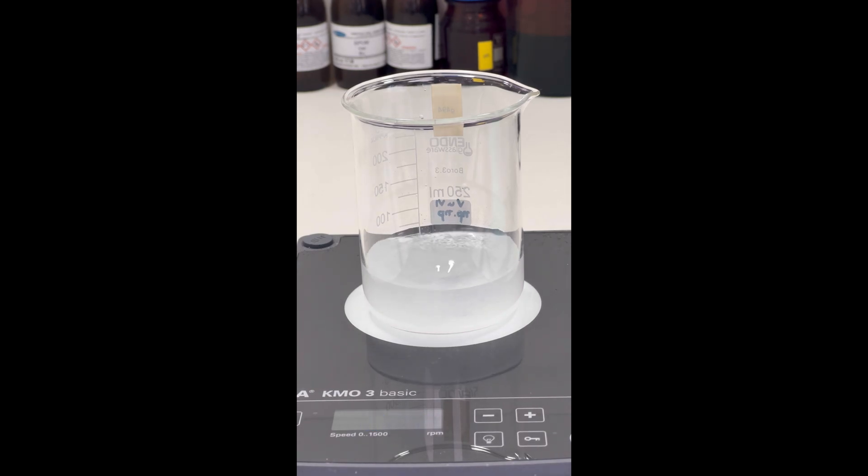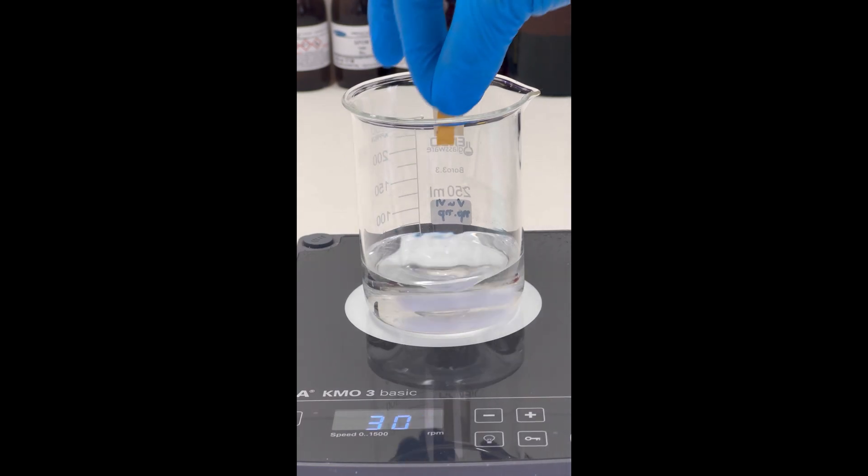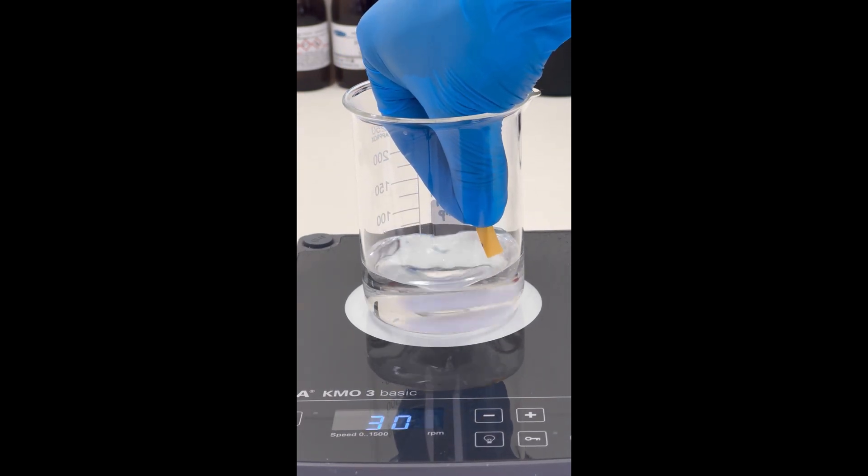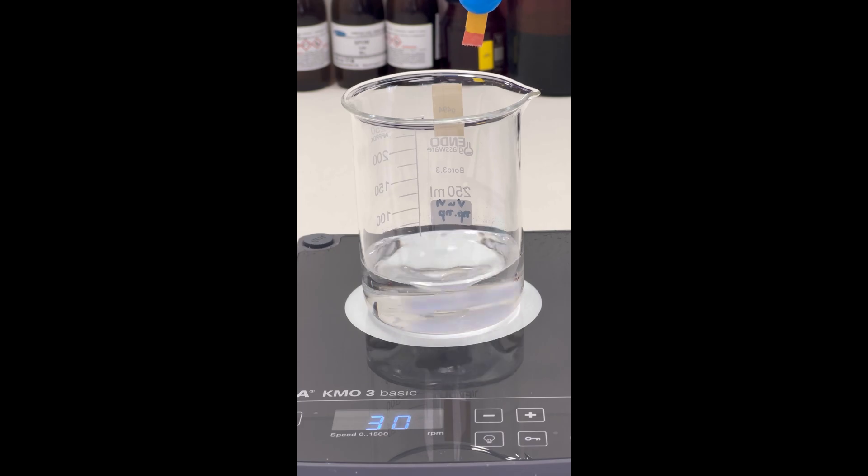With stirring, we soon obtain a clear solution. As expected, the pH is strongly acidic.